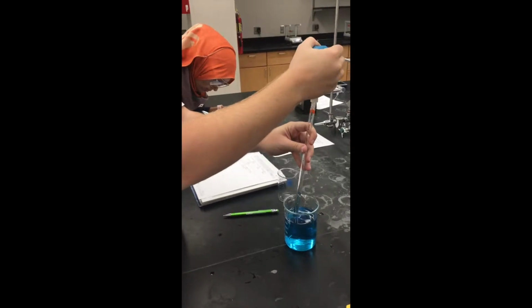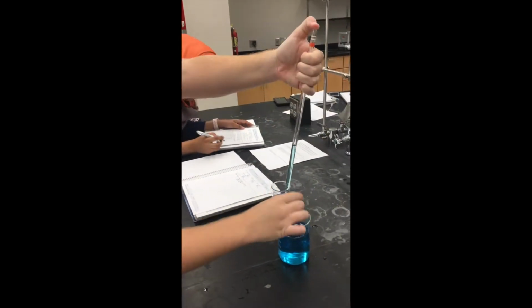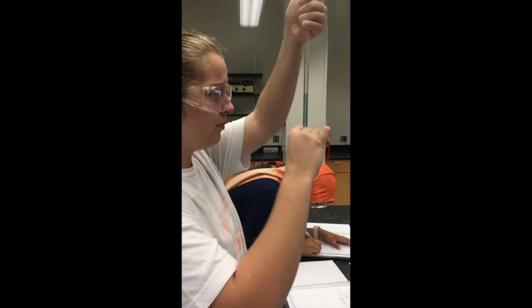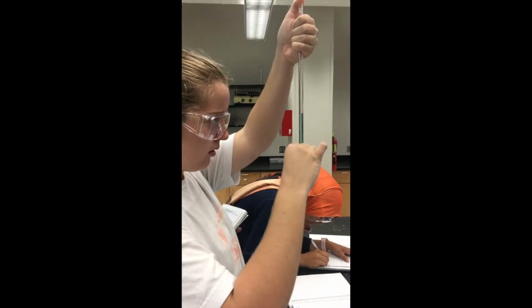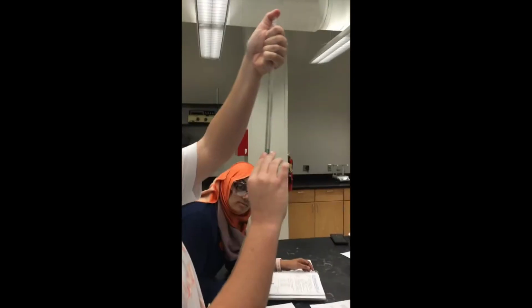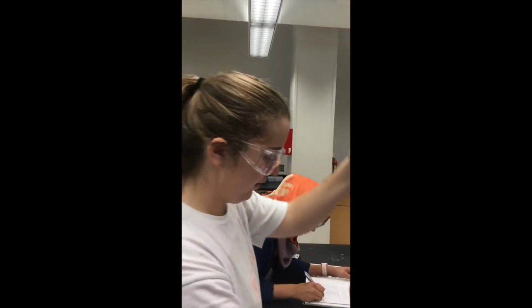Take an appropriate amount from the solution. Then read at eye level. This is going to be your initial volume. Ours was 7.59. Then take out some into another beaker and read at eye level the final volume. Ours was 5.01.